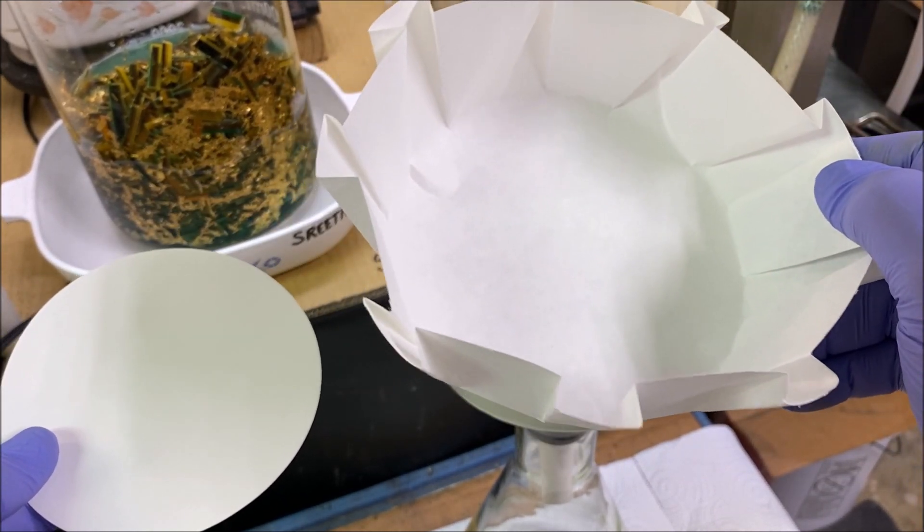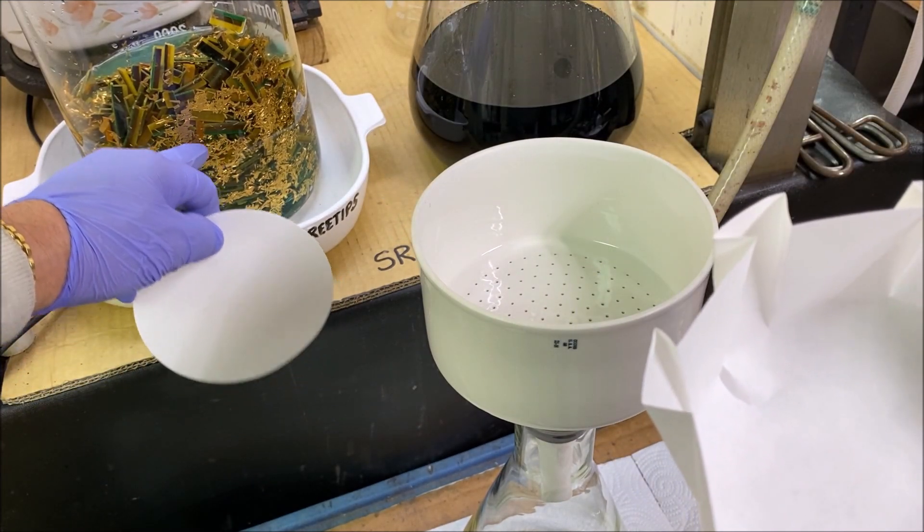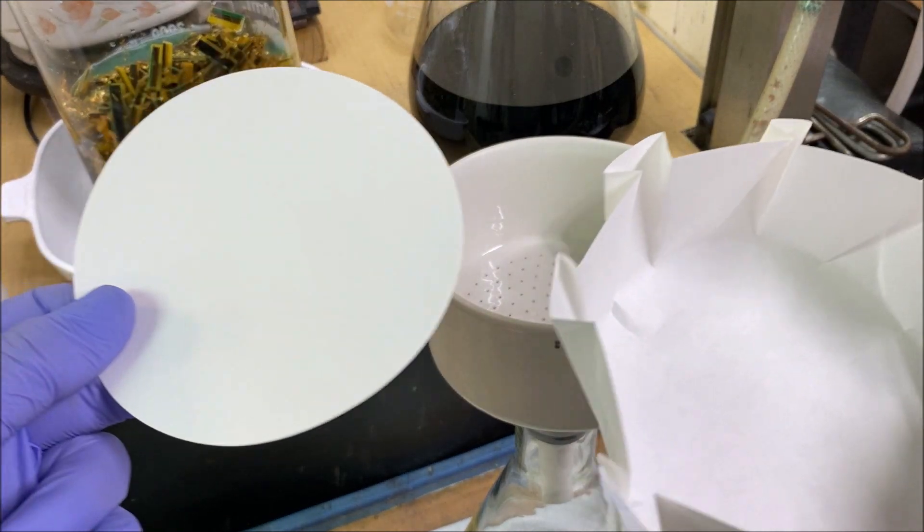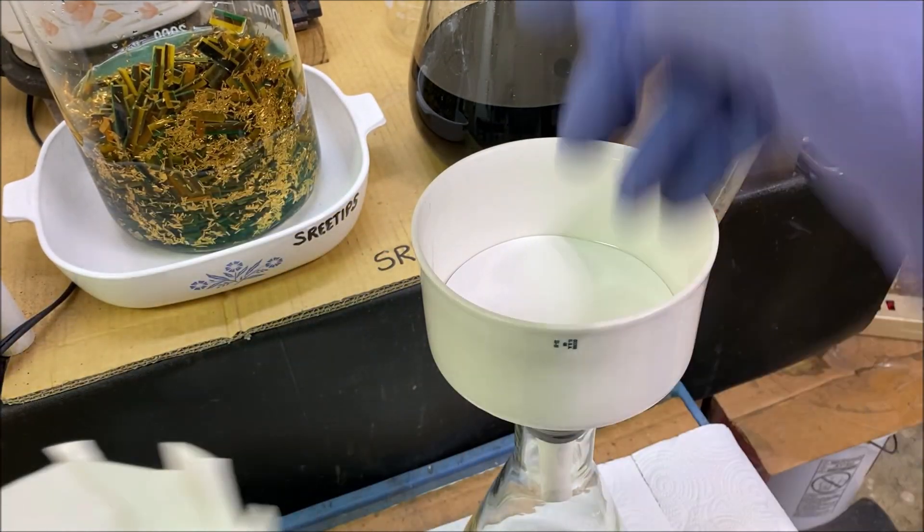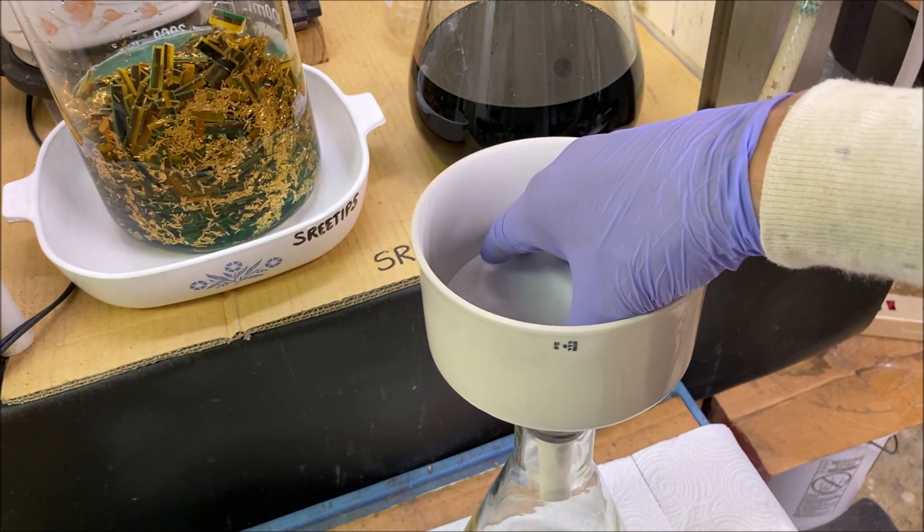If we tried to use a flat filter in there, some of the solids may adhere to the inside walls of our funnel.